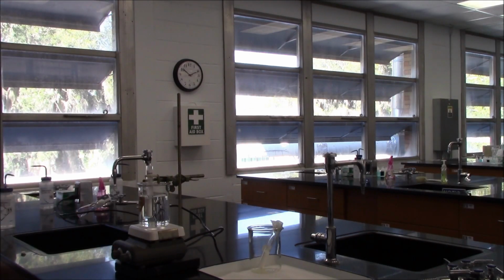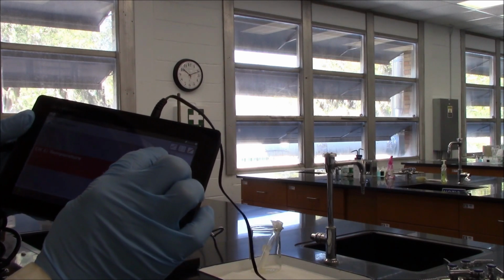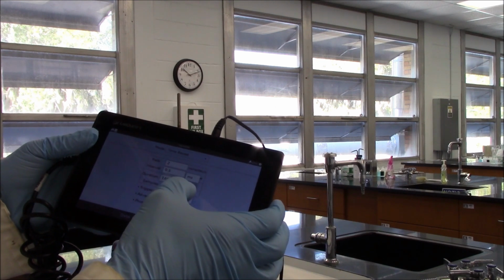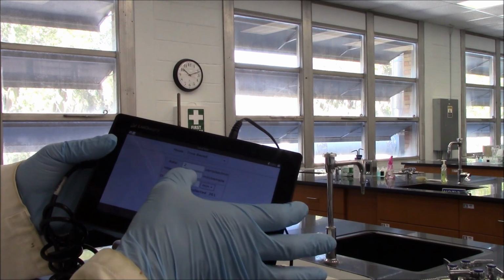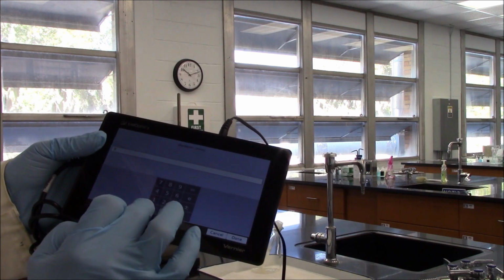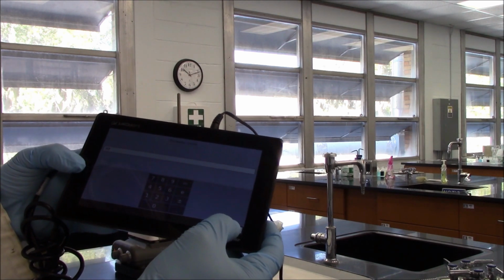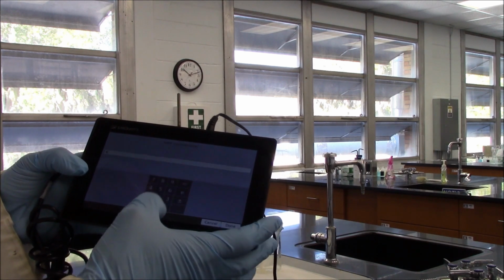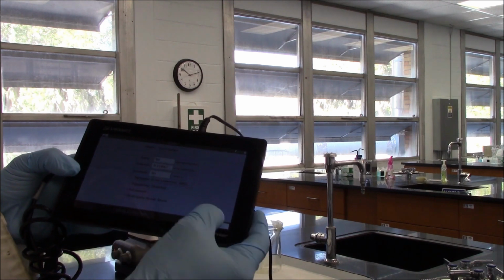While I'm waiting, I will set up the LabQuest device for data collection. If you click this area, you can set up the total collection time. To make sure I have enough time to collect the data from the beginning to the end, I will set up my time to 30 minutes. If it doesn't take 30 minutes, I'm going to stop it when time is up. I want every second to get a sample, 60 samples per minute, sorry. So let me click done, then OK.